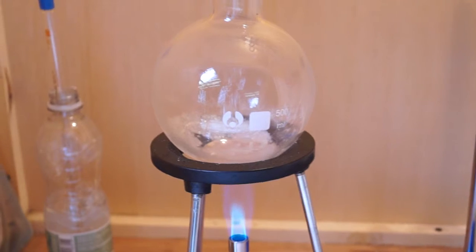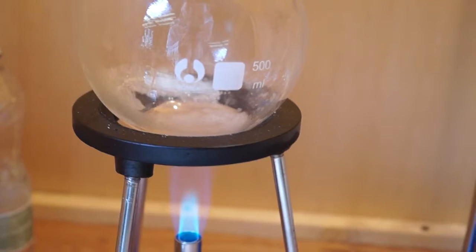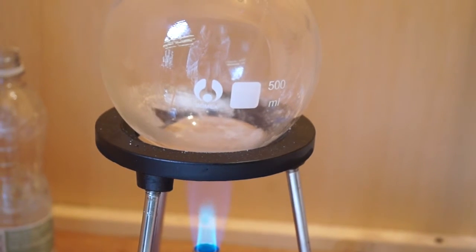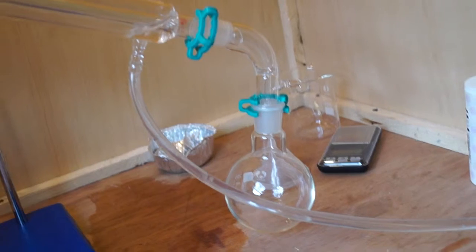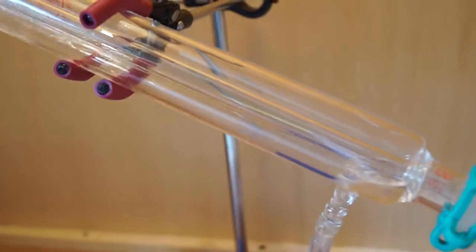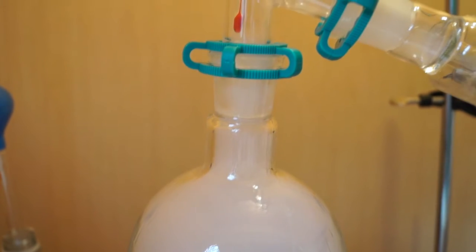After the reaction had finished, I hooked my boiling flask back up to my distillation setup and ignited my Bunsen burner. I carefully heated my mixture of sodium sulfate, acetic acid and sulfuric acid for about 10 to 20 minutes, keeping the temperature between 100 and 120 degrees C. Acetic acid has a much lower boiling point than the excess sulfuric acid, and the sodium sulfate salt allow me to distill it.